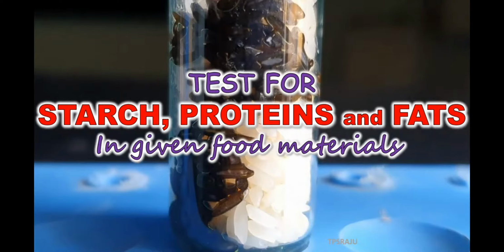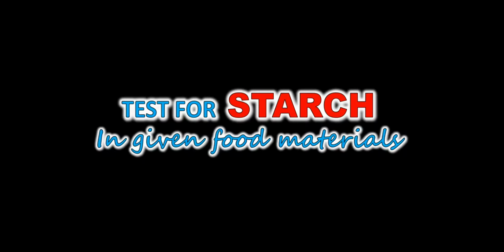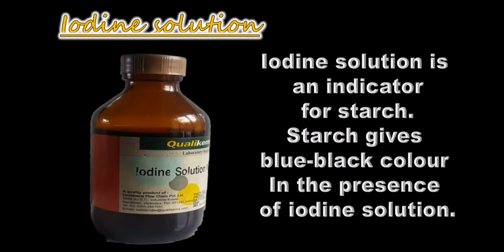Hello students, in the last class we studied what carbohydrate, protein and fats are, right? So we will test for carbohydrate, protein and fats in the given food in today's class, okay? We all know that carbohydrate is present in the form of starch in our food. So the first test we'll be doing today is the test for starch in some food materials.